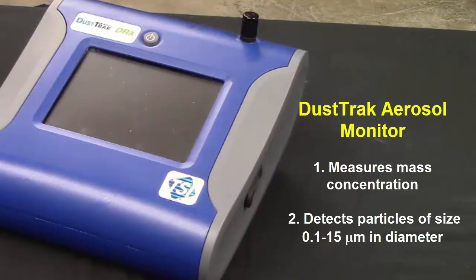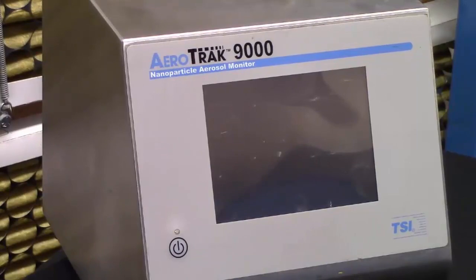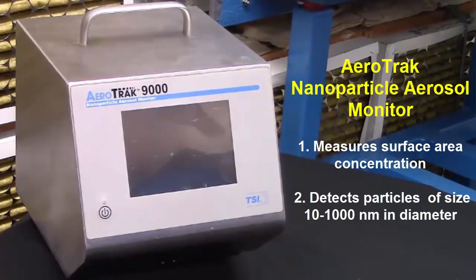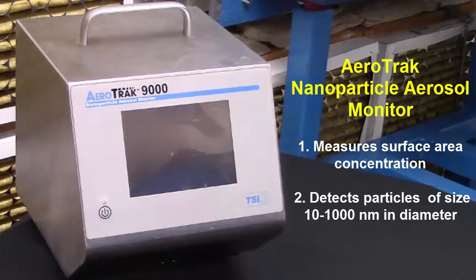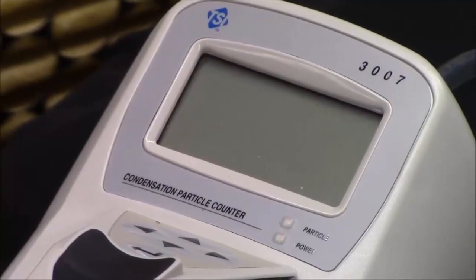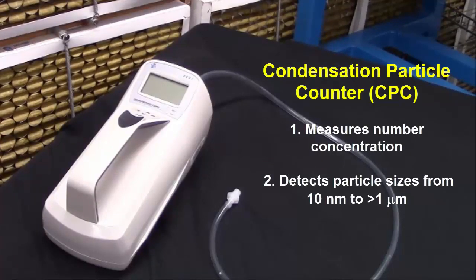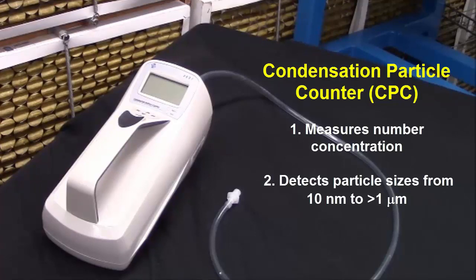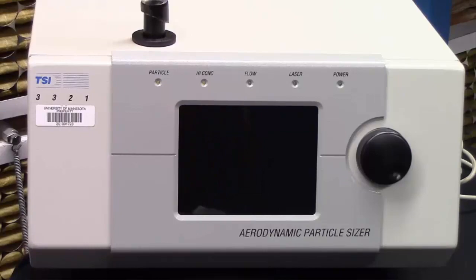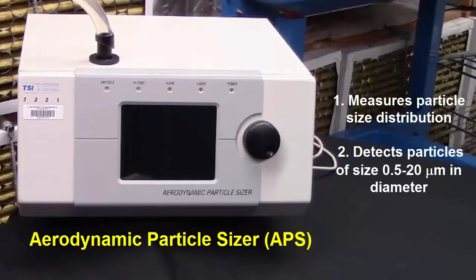Mass concentration is the mass of particles in a unit volume of aerosol. The second instrument is an AeroTrak nanoparticle aerosol monitor, which can measure the surface area concentration of particles 10 to 1,000 nanometers in diameter. The surface area concentration is related to the roughness or porosity of the particle exterior. The third instrument is a condensation particle counter, or CPC, which measures number concentration in particle sizes that range from 10 nanometers to greater than 1 micrometer. Number concentration is the number of particles in a unit volume of aerosol. The aerodynamic particle sizer, or APS, is also included in this activity and it measures particle size distributions from 0.5 to 20 micrometers in diameter.